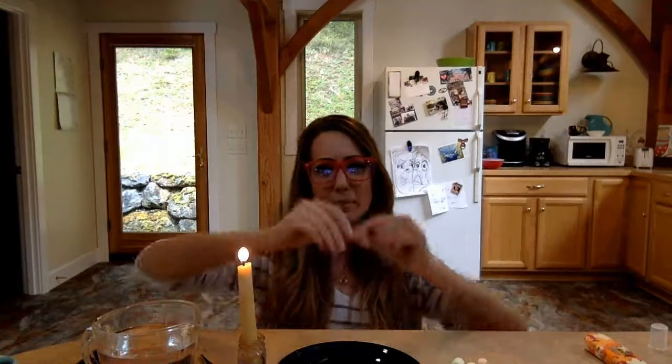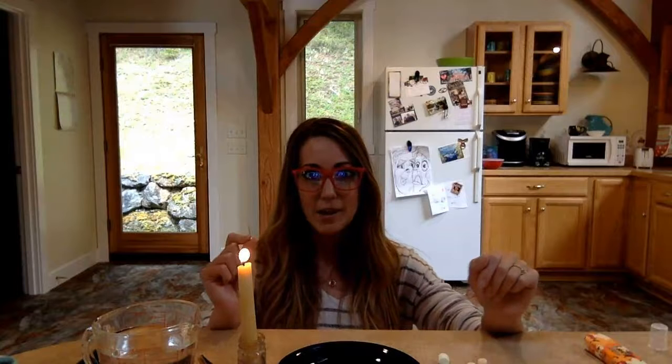Get everyone together. Okay, so for lighting these things on fire, here's what I got. I grabbed my tweezers because those are kind of grippy. I also grabbed like a pin from my sewing stuff, but you could also use like a paper clip that you unbend. Basically, you want something metal that's not going to catch on fire itself and stabby that's going to hold your stuff and not going to let you get burned.